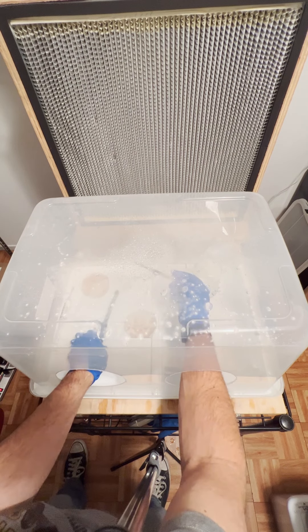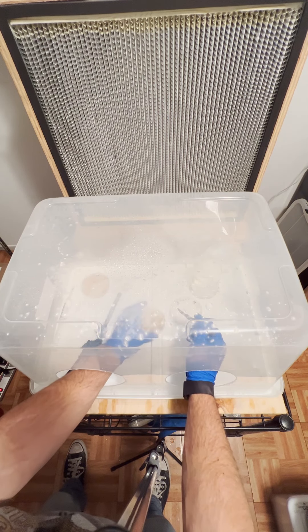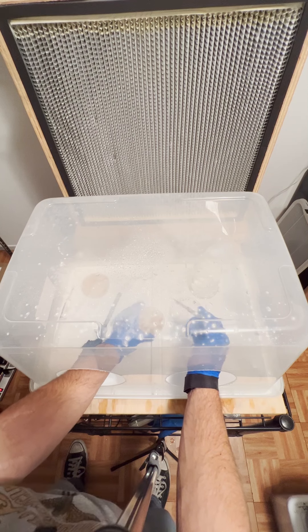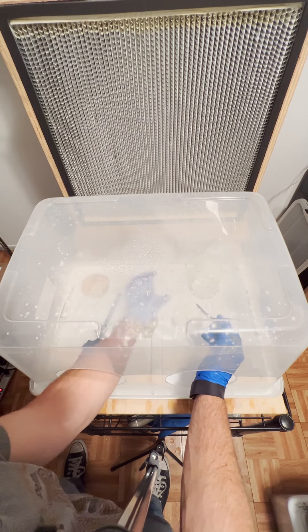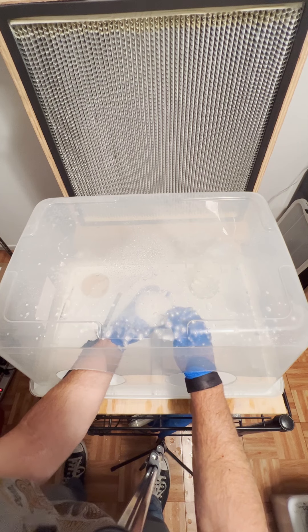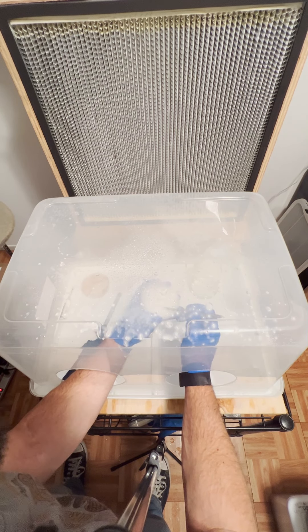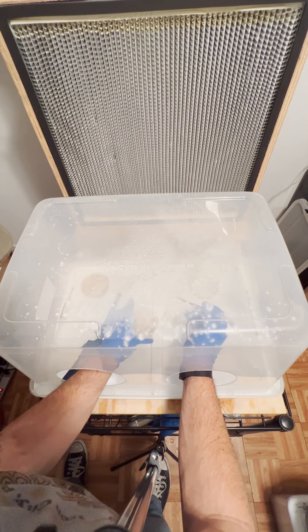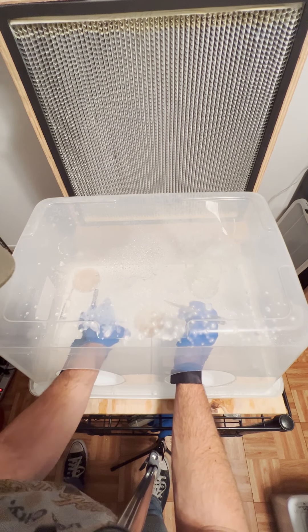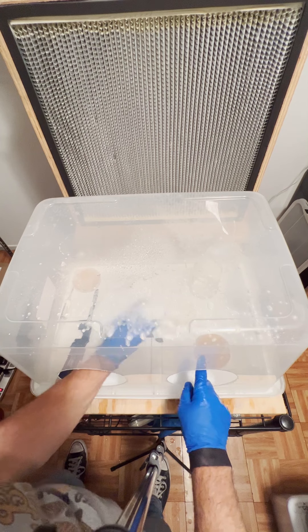Once the scalpel is red hot, what we're going to do is open our empty agar plate — the one we're transferring to — and just take the scalpel and shove it in, which wipes the soot and anything else that might have been stuck on the end off into the plate to the side. Now we take our fresh plate. Because this mycelium is incredibly overgrown, I'm just taking a chunk from kind of anywhere. Normally you'd be looking for the best genetics — what's growing the fastest. Take this, move the plate over here, drop it straight down inside, and drag the scalpel across the agar — that's the easiest way to get the stuff to release. And just like that, you're done.